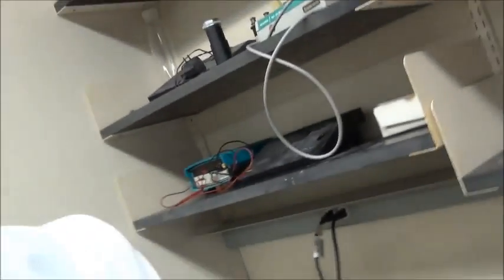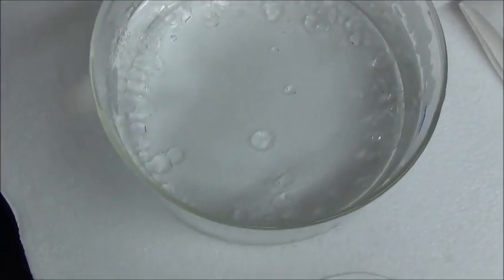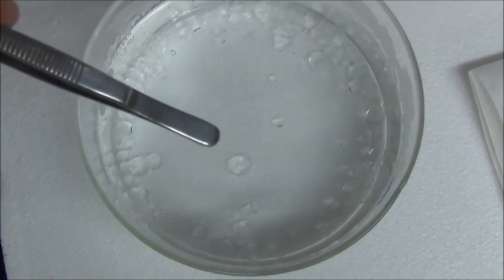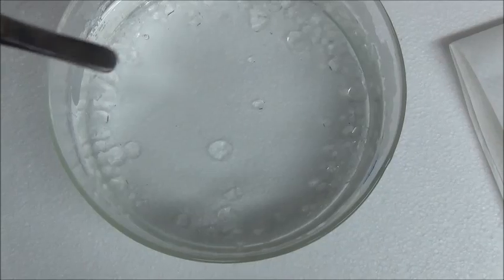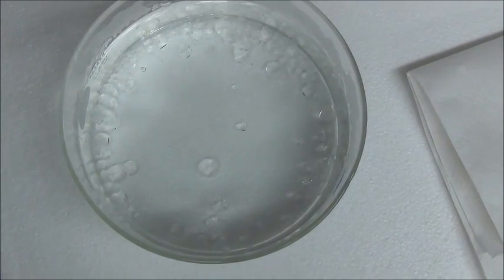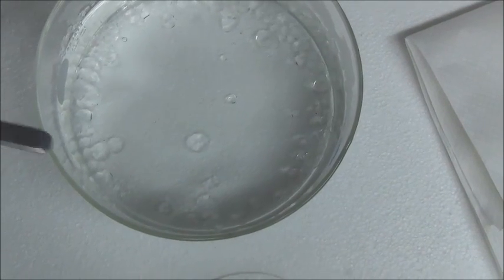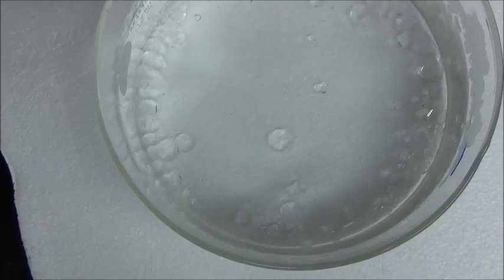Here we are a few days later - actually almost four days later. That solution that we set aside has now been crystallizing, and in fact we have some crystals in here. Today we're going to harvest a few of these crystals. I'll just point these out - you see a large crystal here, it's well isolated. That's the reason for using the large flat dish: this gives crystals the opportunity to grow and get larger without bumping into other crystals.